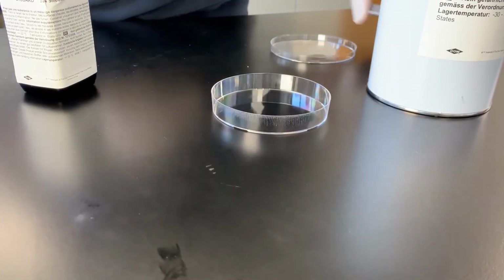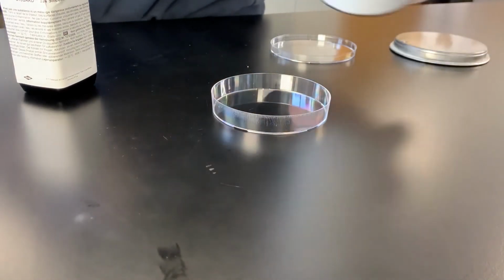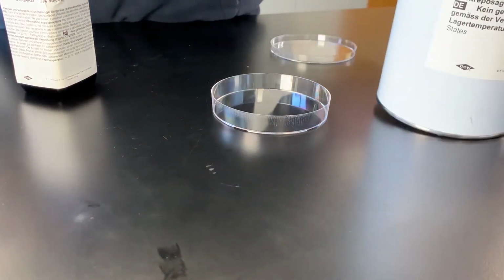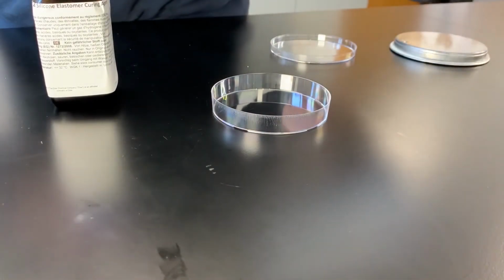is mixed in a 10:1 ratio. So if you add 10 milliliters of part A and then add 1 milliliter of part B, you end up with a silicone that cures really nicely.